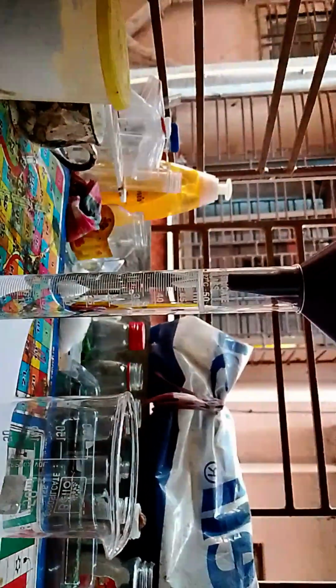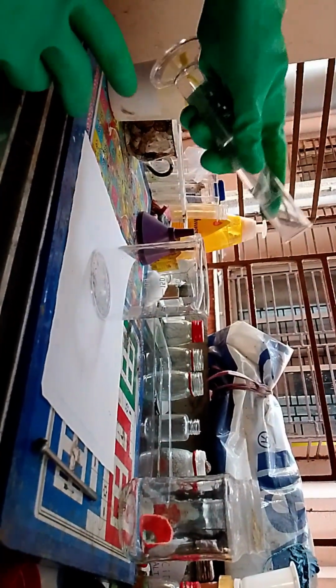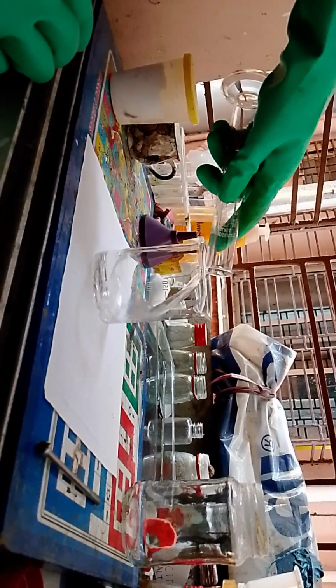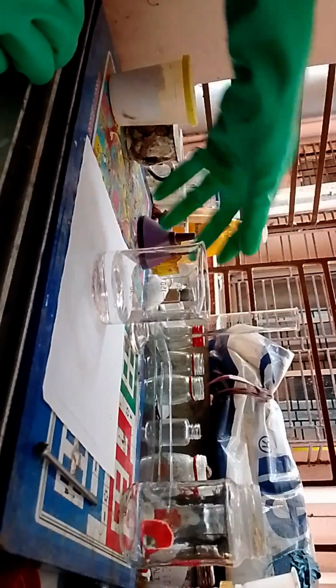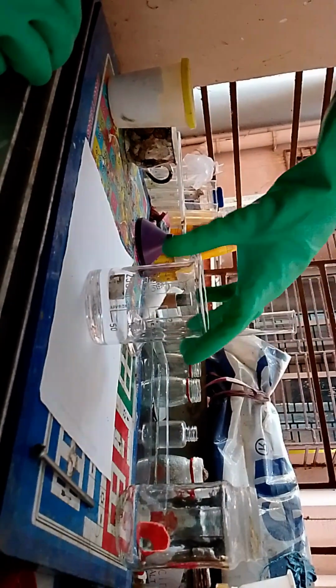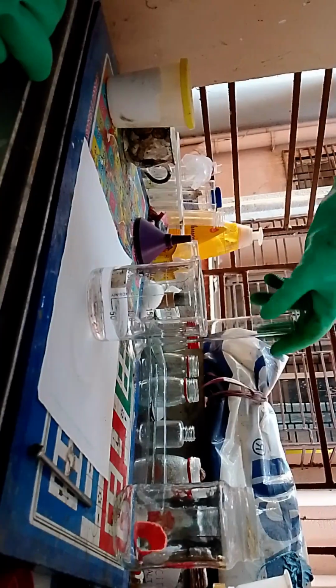I hope you can see the mark now. Yeah, great. Now let's flip this away. We need to pour it into the beaker. We could just use approximate values here, but it's much more detailed this way.